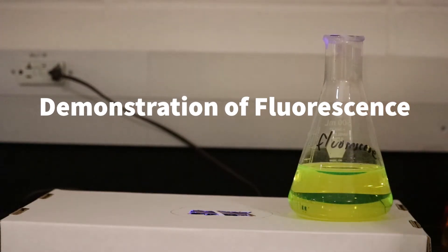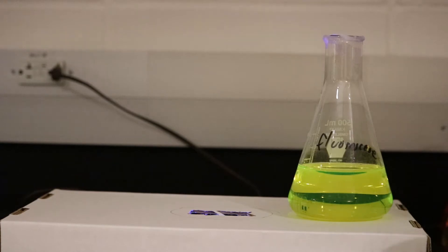I'm going to demonstrate the fluorescence associated with a number of different compounds. Fluorescence is when we expose a substance to a shorter wavelength of light and it emits a longer wavelength once the light interacts with it.